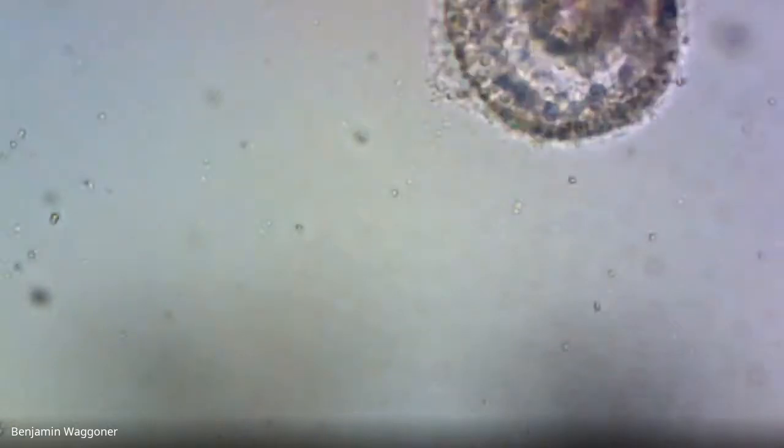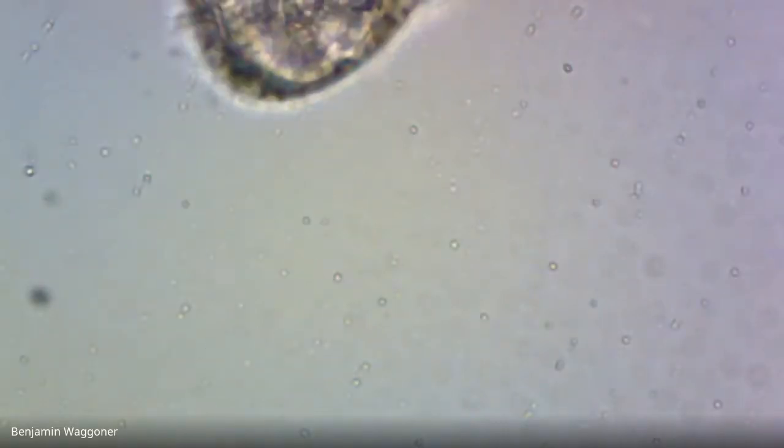We're looking at the sea urchin embryos after nickel exposure. Okay, and this one has quite a bit more. All right, I'm going to start panning around, and I think this has enough that we could actually get some numbers on this.